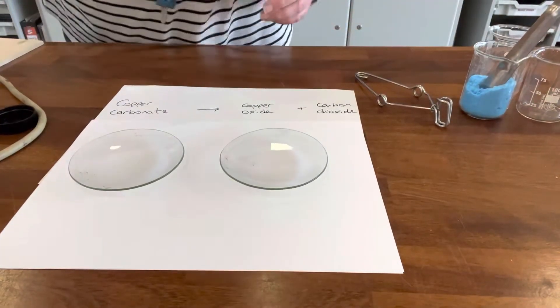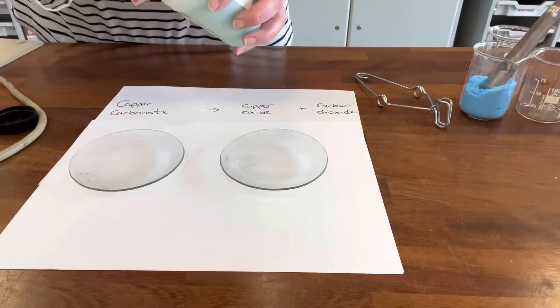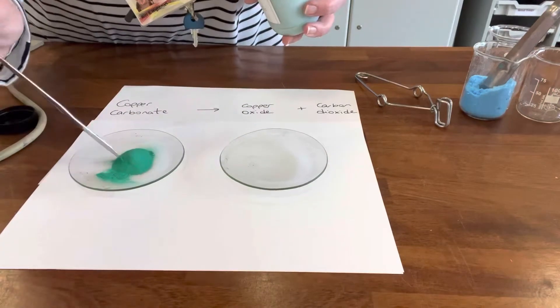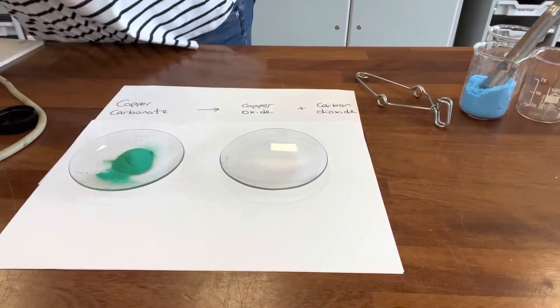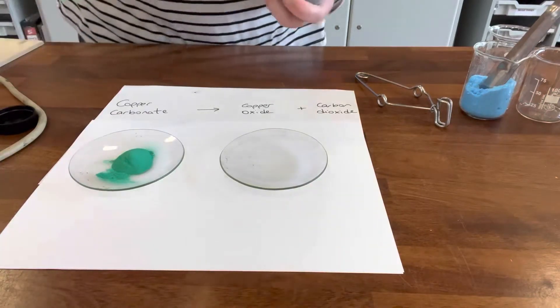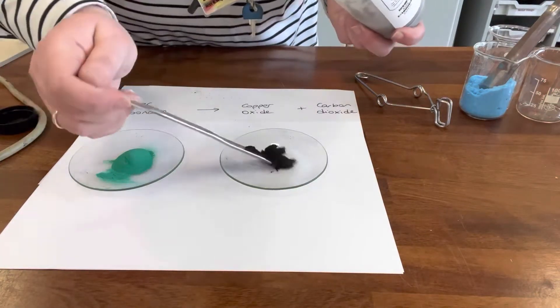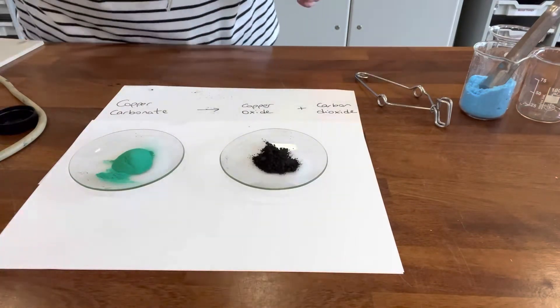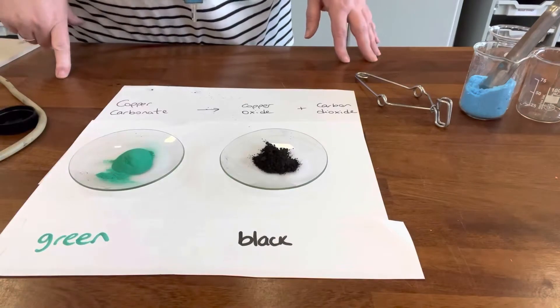Before I show you the heating and the thermal decomposition, I just want to confirm the colours of these substances. Copper carbonate is a green solid, and when we heat it, it decomposes and breaks down into copper oxide, which you may remember from previous topics is a black powder. So we should see it going from green to black.